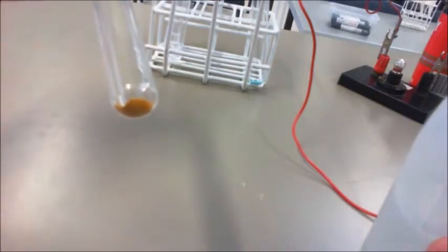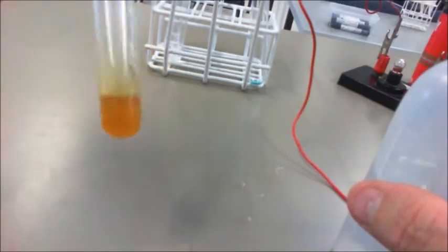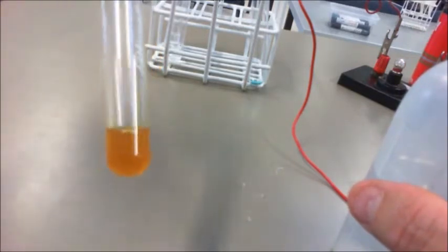Here is iron now, and you can see iron is sort of a brownish, almost looks like the colour rust. Okay, again we add some water to that, and we can see there that most of it's actually dissolved into the water. Give it a bit of a shake just to get around. Most of it's actually dissolved into the water, and it gives us that brownish colour.